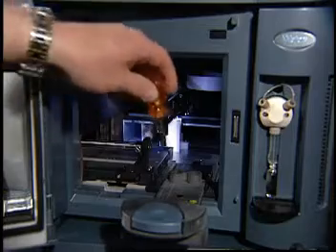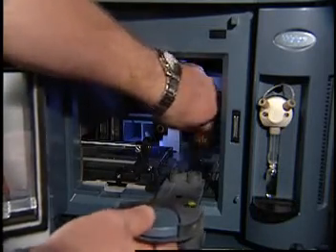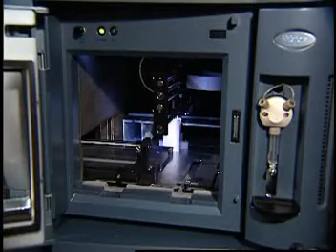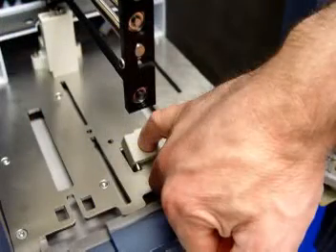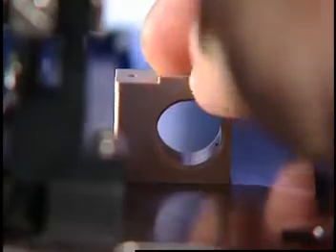Next, loosen the screw holding the sample tray holder in place by turning it counterclockwise 1/4 turn. If your system does not include a sample organizer, there will be 2 sample tray holders to remove from the sample chamber. Using your finger, remove the teach block from the sample manager chassis. Next, insert the teach block into the locating holes.